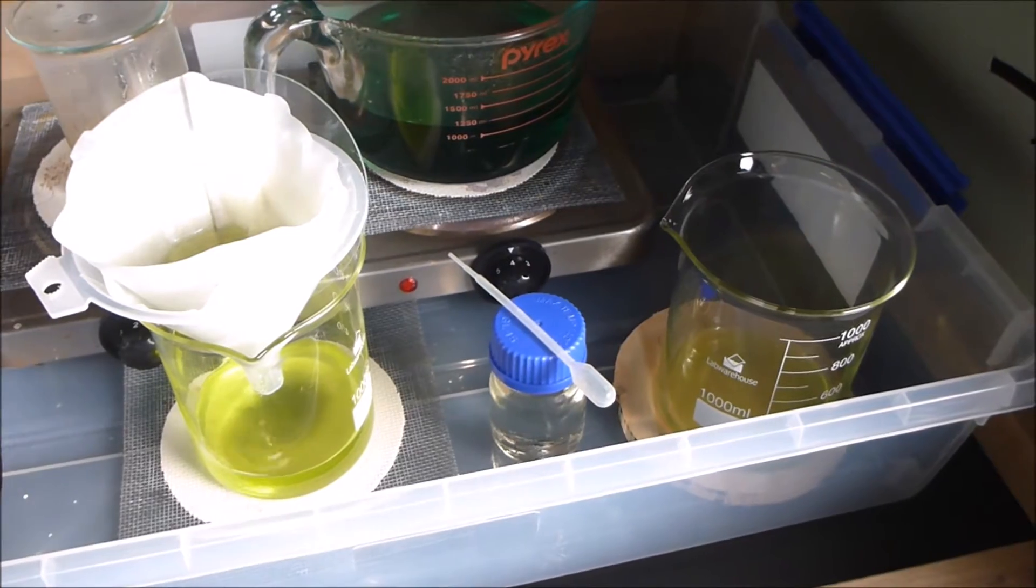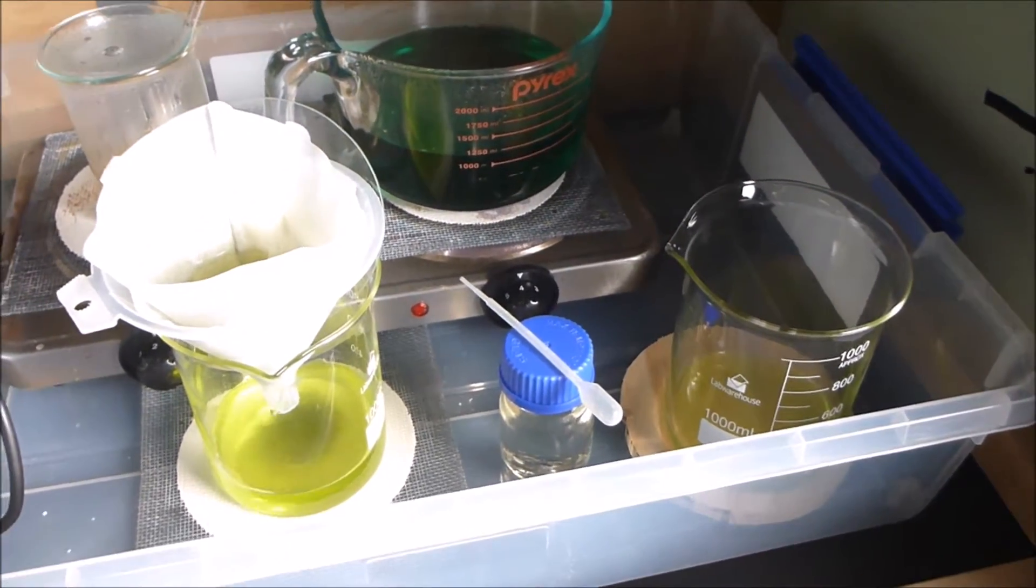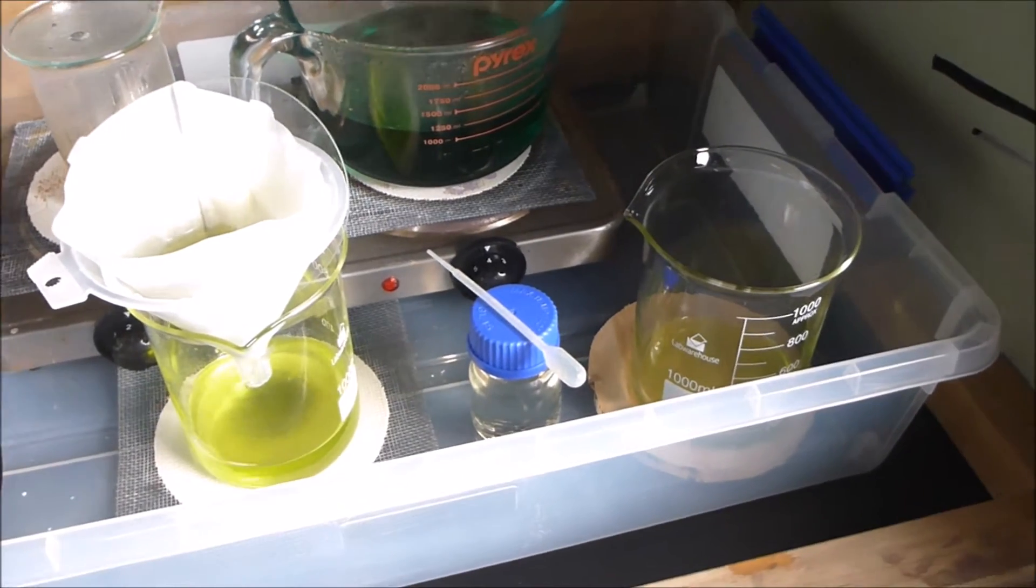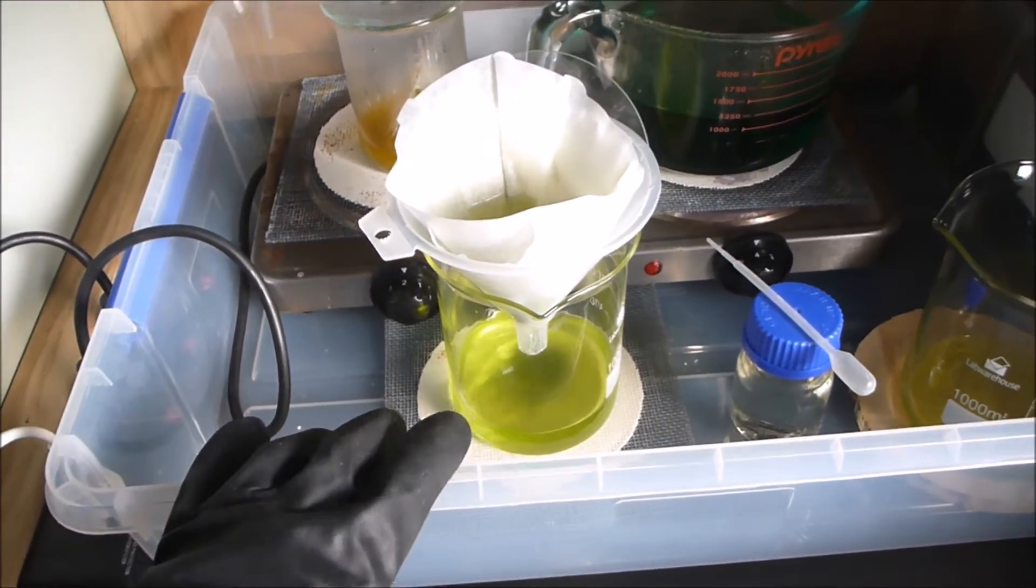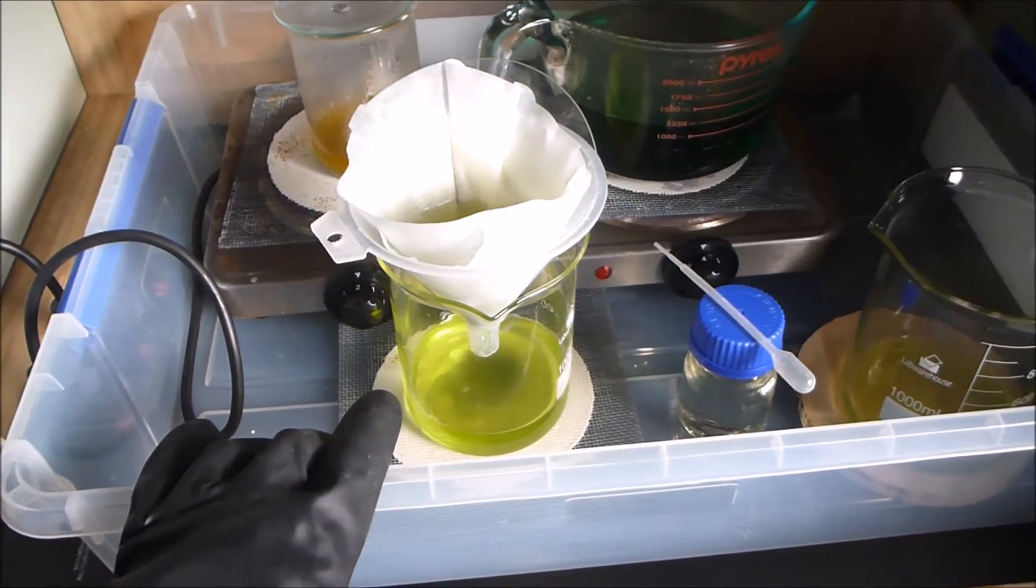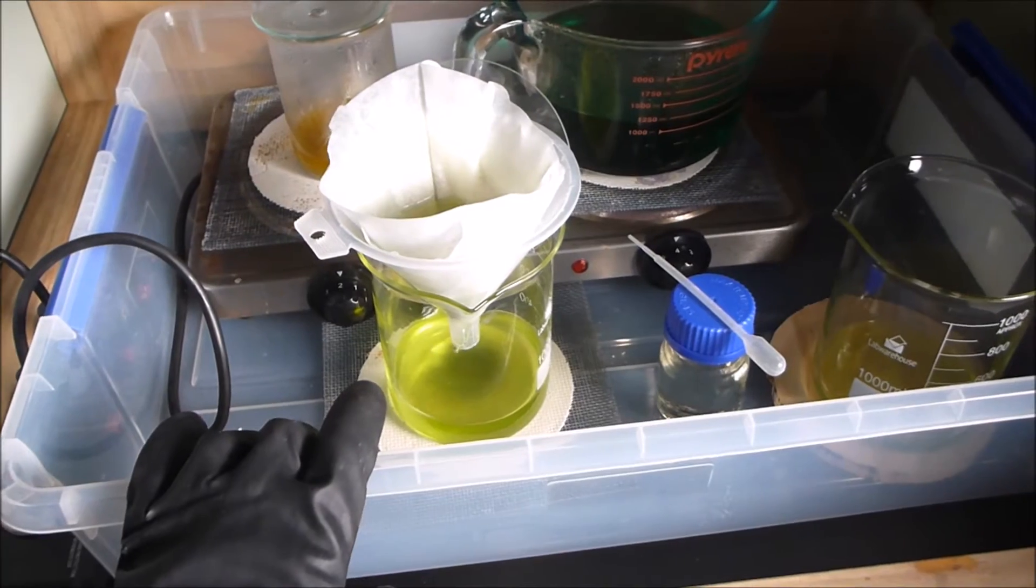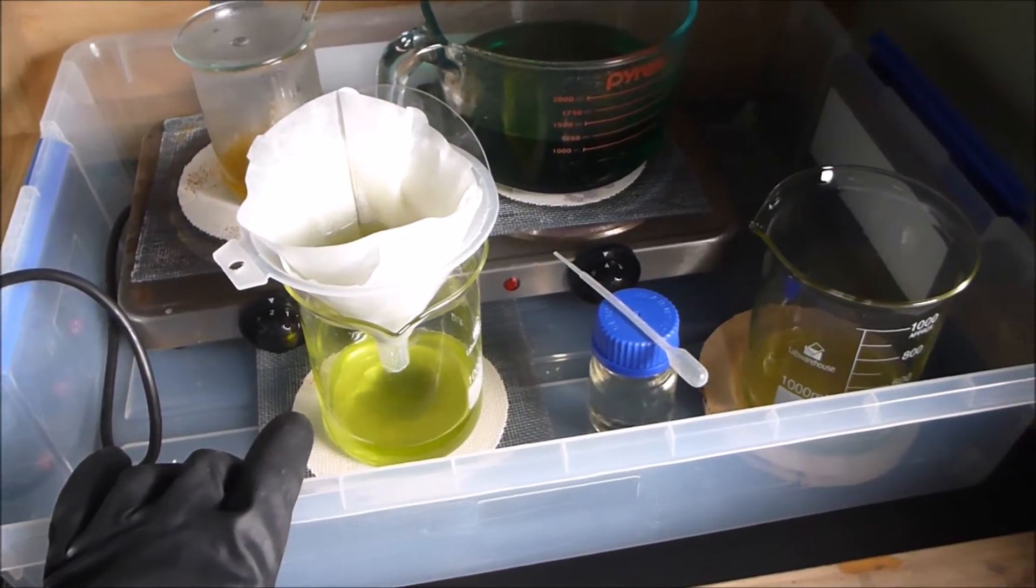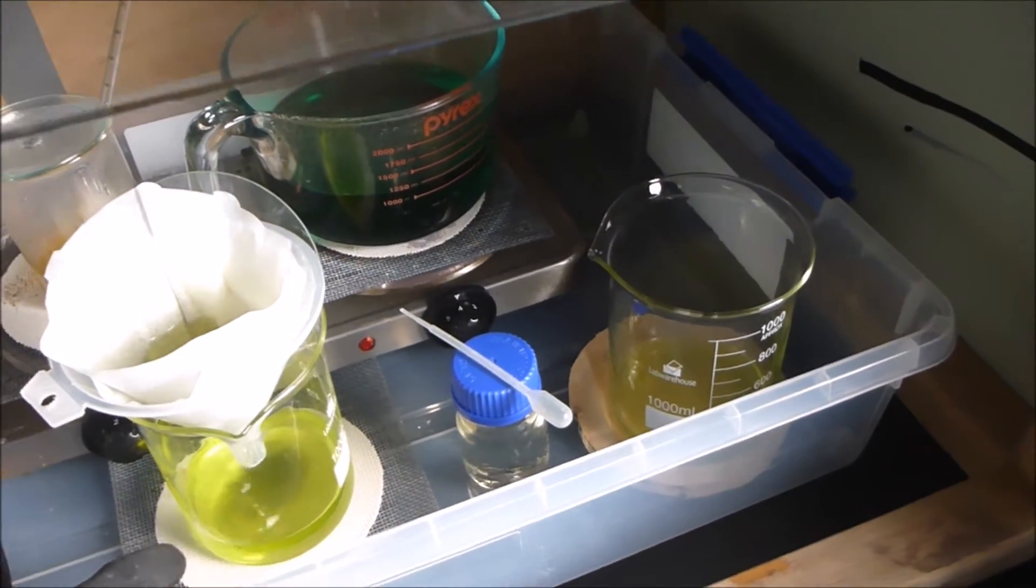One of the things she's quite clear about, but is often overlooked - and I definitely overlooked it at the start - is that she says very specifically to make sure that all of your AR solutions are crystal clear before you precipitate the gold. The importance of that was lost on me until I precipitated some gold in a cloudy AR solution.